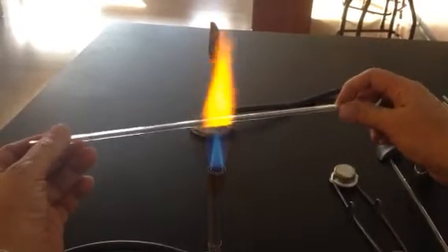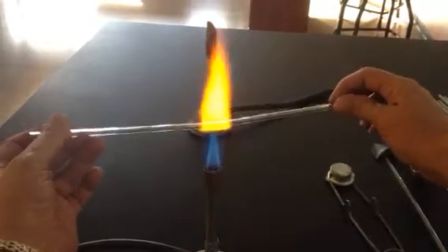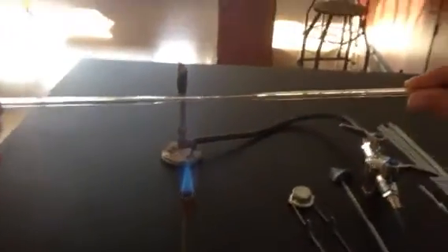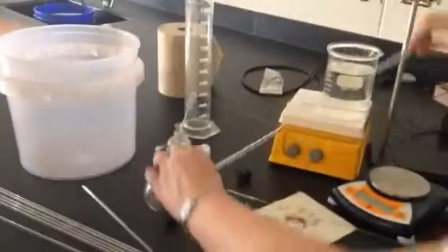So we'll see what that looks like. See how it's starting to get bendy? Now I'm still rolling it, but I'm trying to keep it straight. And then I'm going to take it out of the flame and I'm going to stretch it. And because it was hot, it was pretty easy to stretch. Once it's kind of stiffened up, I'm going to lay it flat on the table, not touching that hot spot.